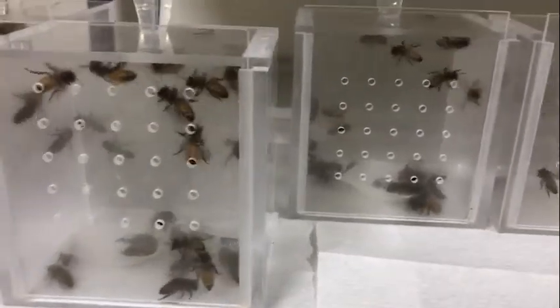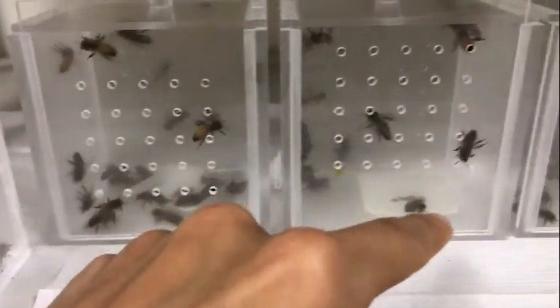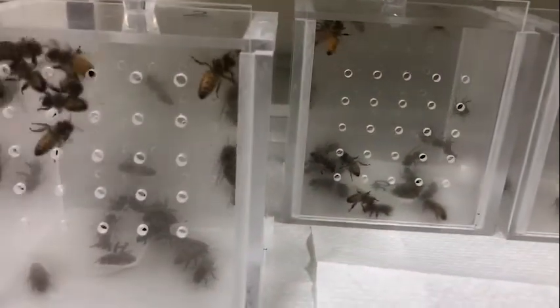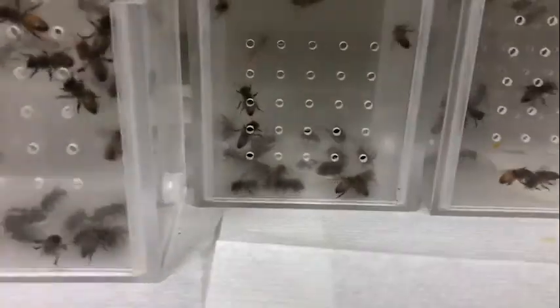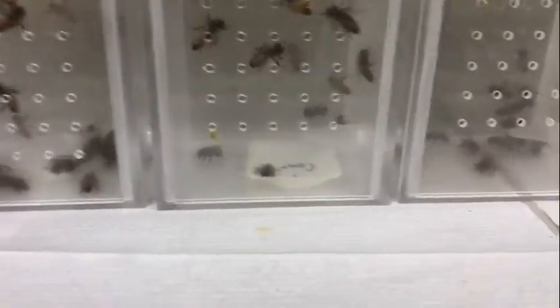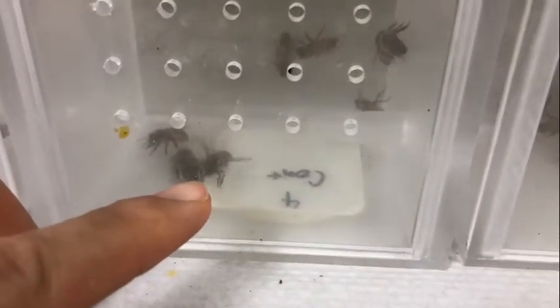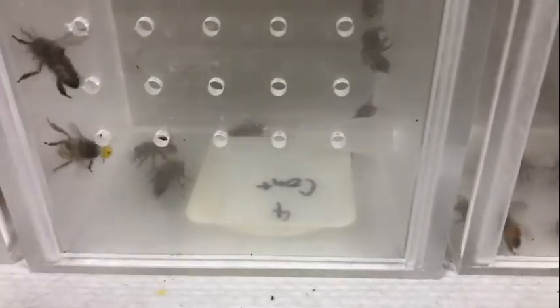The infection process is done using these little loops that you can see. I should say it's artificial in the sense that we mix it up, but it's still primarily based on royal jelly, which we purchase. There's nothing you can rear bee larvae on that's not royal jelly based that I know of. But we can add sugar solution and some yeast protein and things like that to make it more of the worker diet, which is much easier to work with than pure royal jelly.